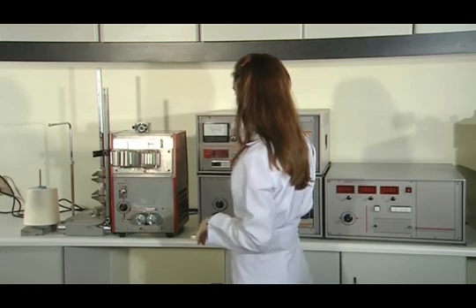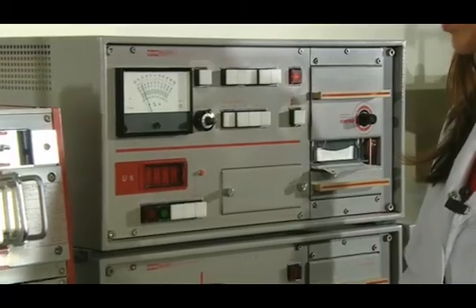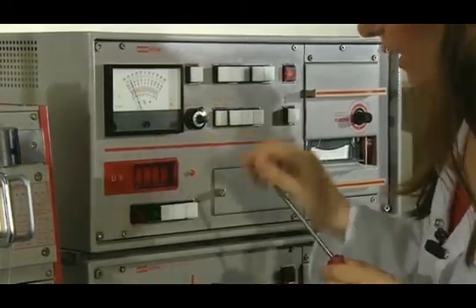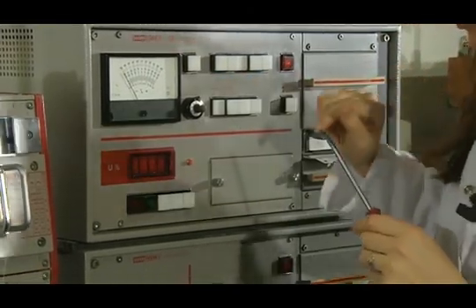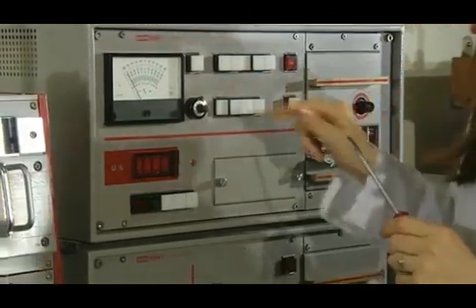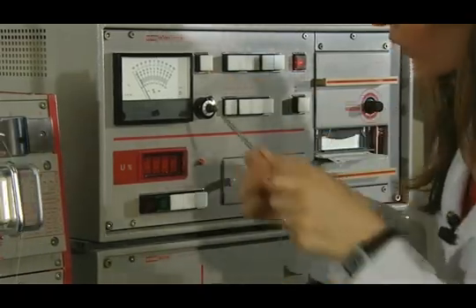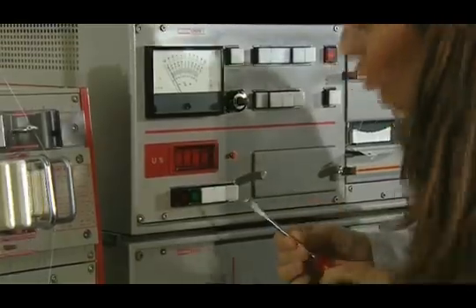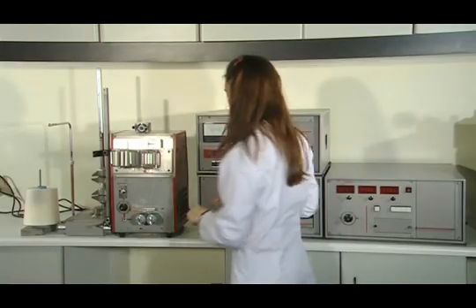The first task is to reset the ammeter. If the ammeter is not set to percentage, we press that button. Then the light goes off, and the ammeter is still not set to percentage. The appropriate setting is done by tightening that screw. In this case, the ammeter is set to percentage, so we do not need to do anything.